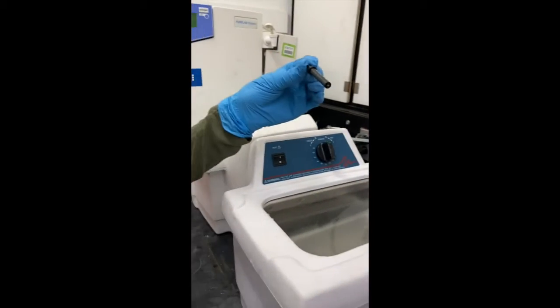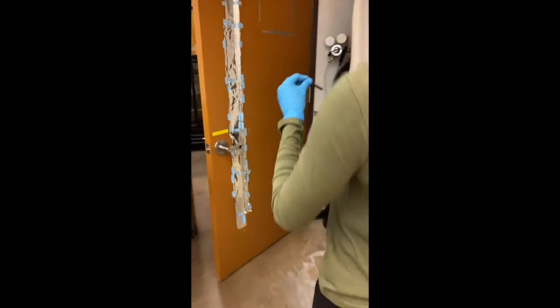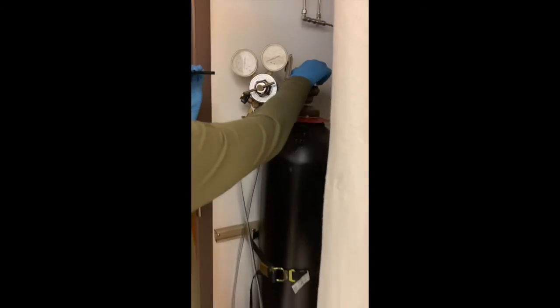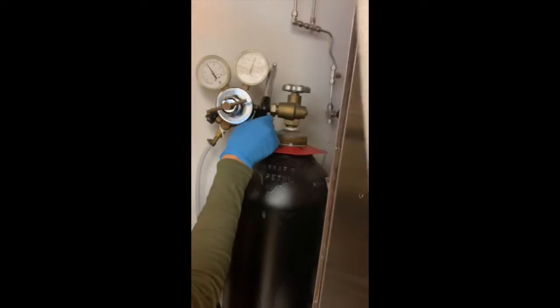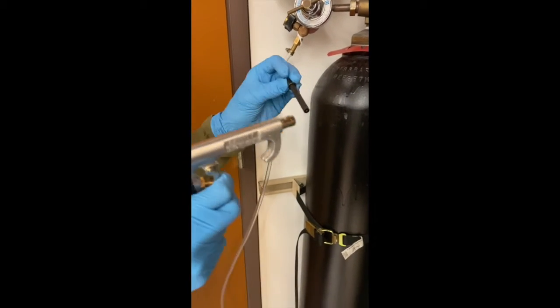So we're done with sonicating, so we're going to take the MIP over to the nitrogen tank and turn it on just a little bit. And we're going to spray with nitrogen gas until it's dry.